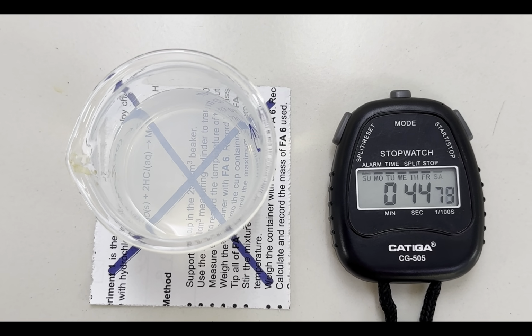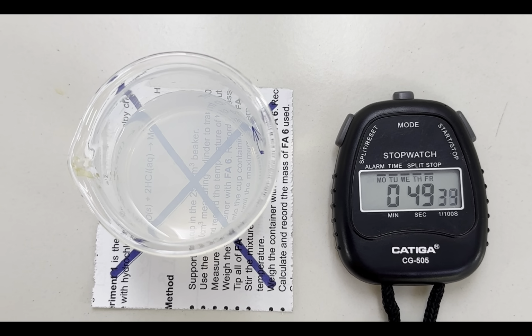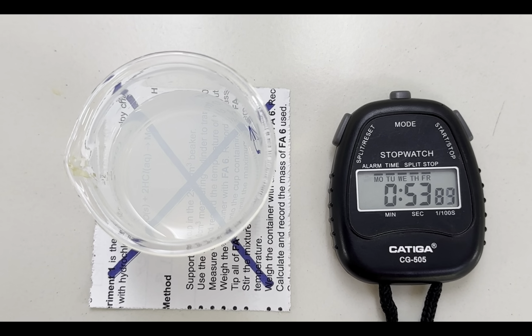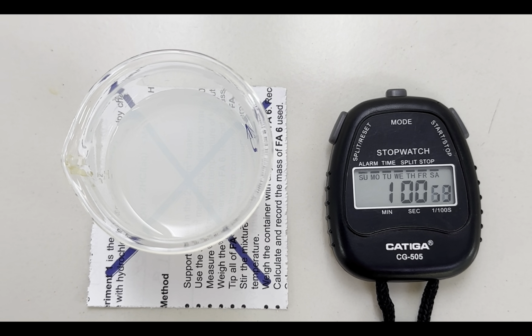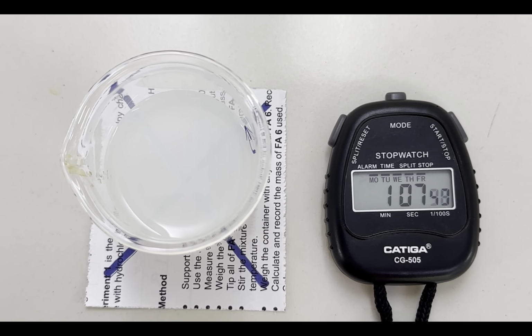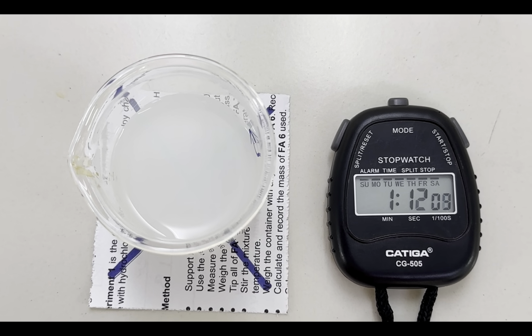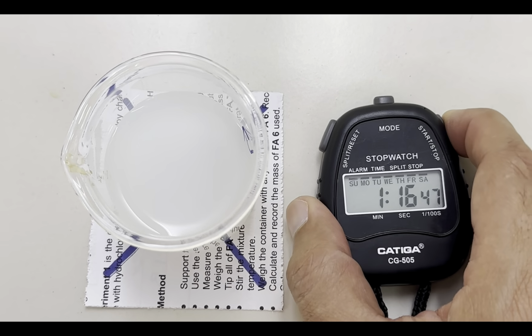With the normal understanding, we can estimate that we are increasing the volume of water, therefore the solution is getting more diluted. That is why the reaction time will increase, because the reaction rate is getting slower with dilution. Here we can see that it has passed the previous time of 1 minute and 3 seconds, and still we can see the cross, and now it's completely gone.